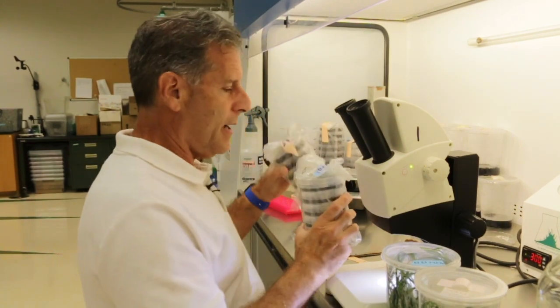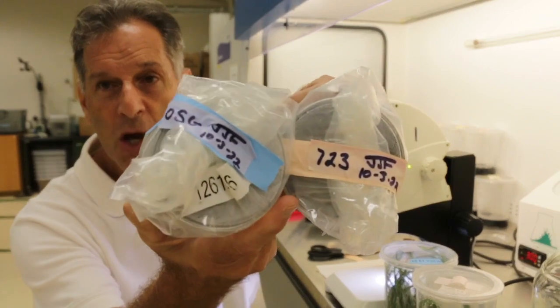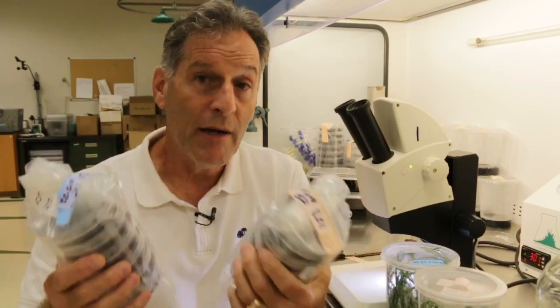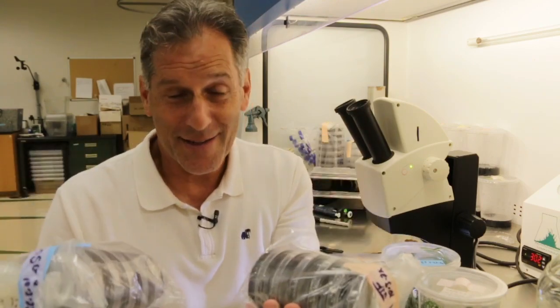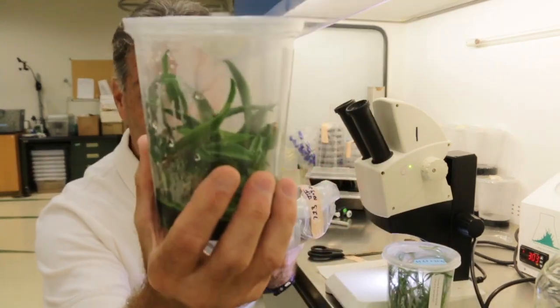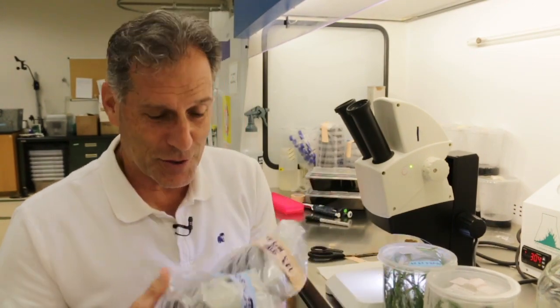Whenever I do seed plating, I always compare P723 to my orchid seed germination medium — same size plates, same everything, same seeds going in. Because of my career as a scientist and plant scientist, I like to do these comparisons and side-by-side tests. I've done a number of different medium component trials. I'm still trying to figure out what's in the banana baby food in this formula — I know it's bananas, and I'm trying to dissect out what the active components are for the replate medium that makes these orchids grow so nicely.